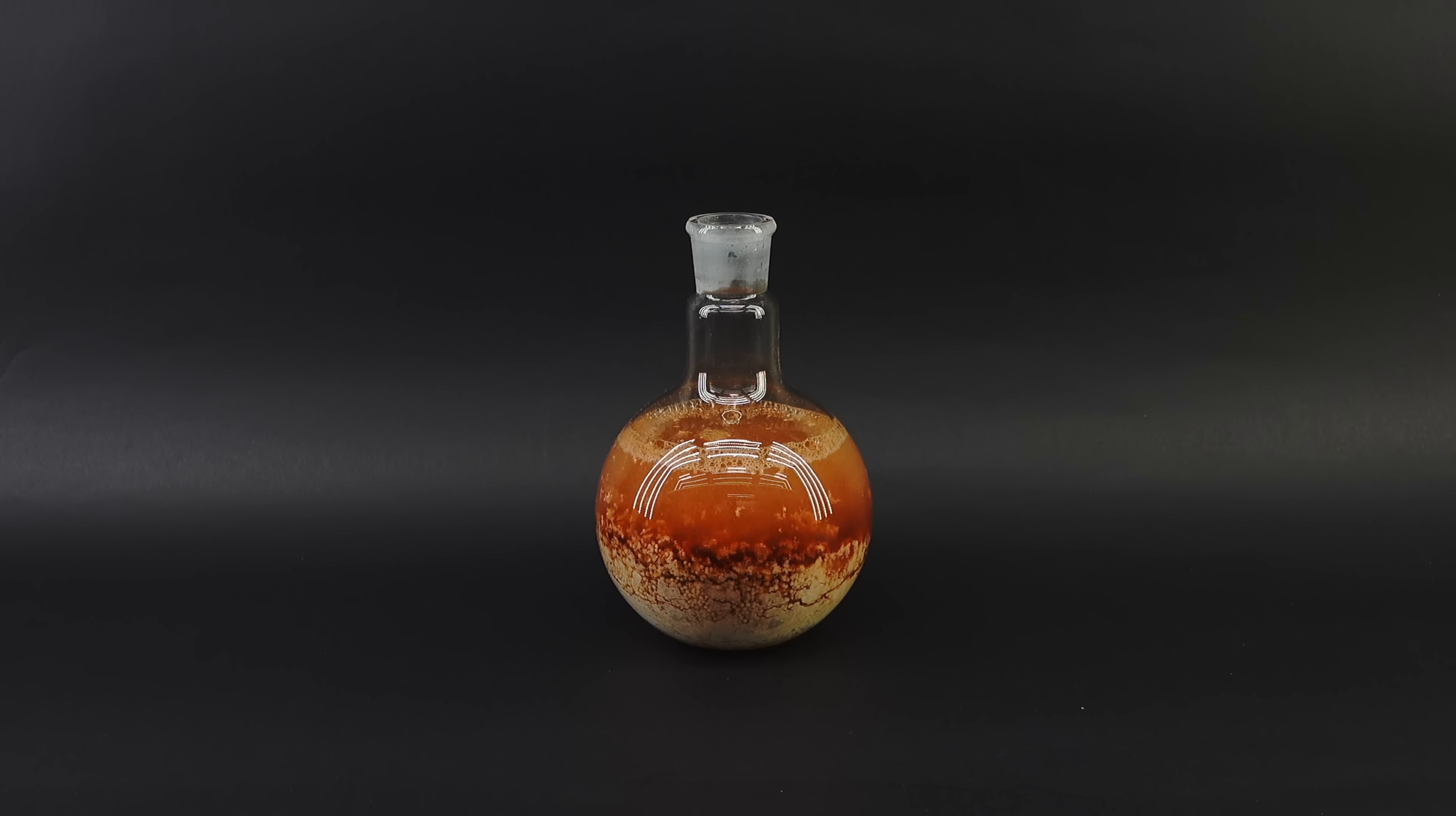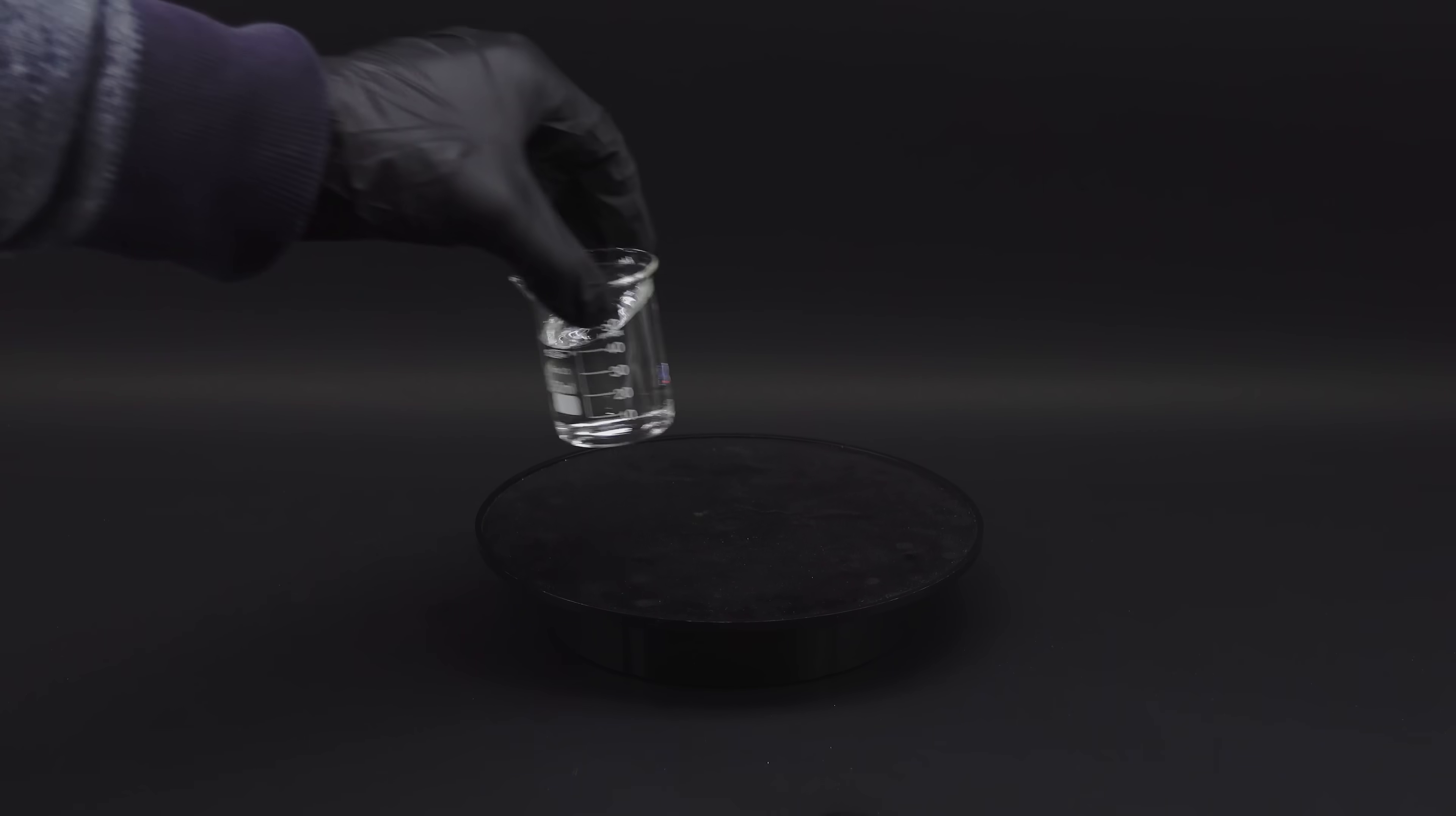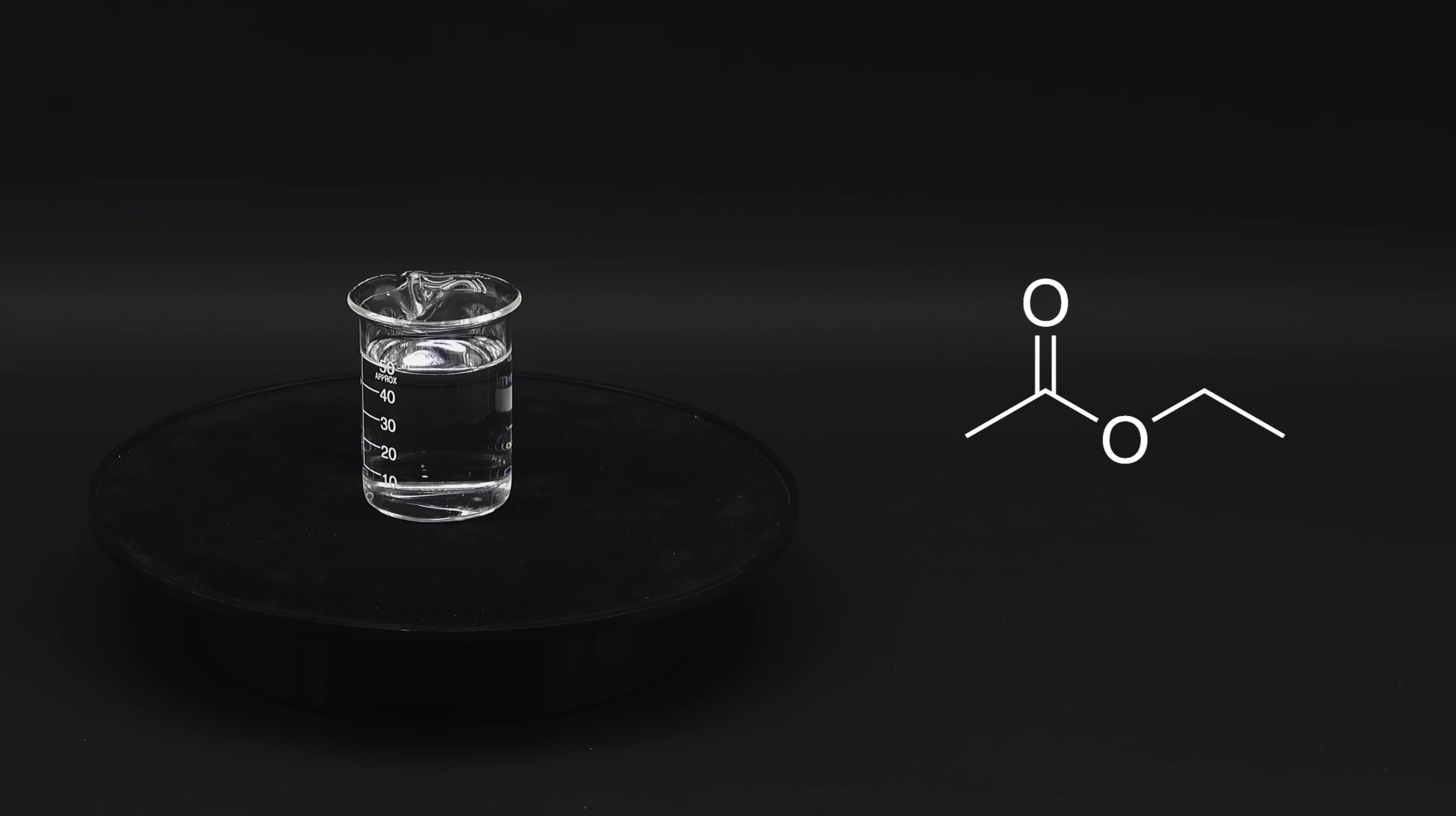That's exactly why, feeling really confident that I can nail this project and that nothing is going to go wrong, I jumped straight into it. The core aspect of this whole thing is going to be figuring out how to beat the hell out of ethyl acetate so that it turns into alcohol. You see, the chemical formula of ethyl acetate looks like this, while the one of vodka, or rather the alcohol in it, looks like this. It doesn't take much reasoning to see that they are quite similar, and to make alcohol out of my ethyl acetate, I basically have to break it up.